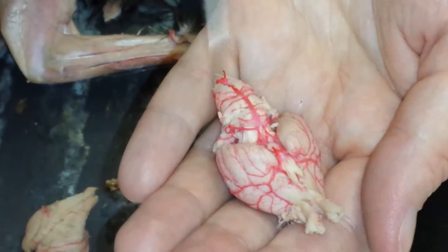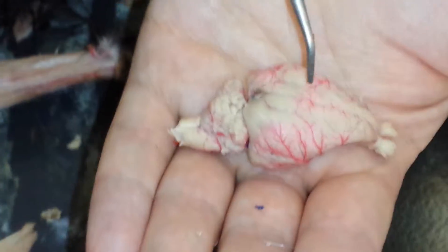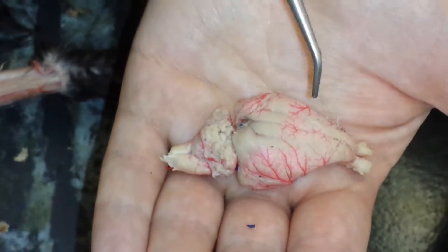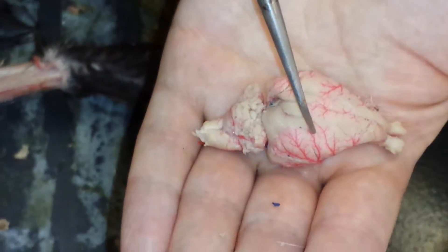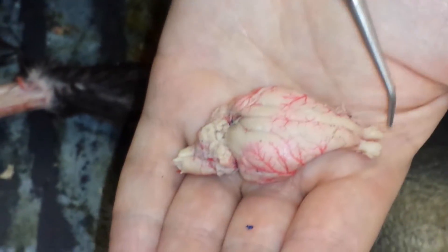The cerebellum is the part back here, on either side — you'll see that much better in the dorsal view. This is a really nice brain. So these are the cerebral hemispheres. The cerebrum has these two hemispheres, right and left. Because the dorsal view is the same orientation as for you, this is the right hemisphere and this is the left cerebral hemisphere. We have olfactory lobes again here.